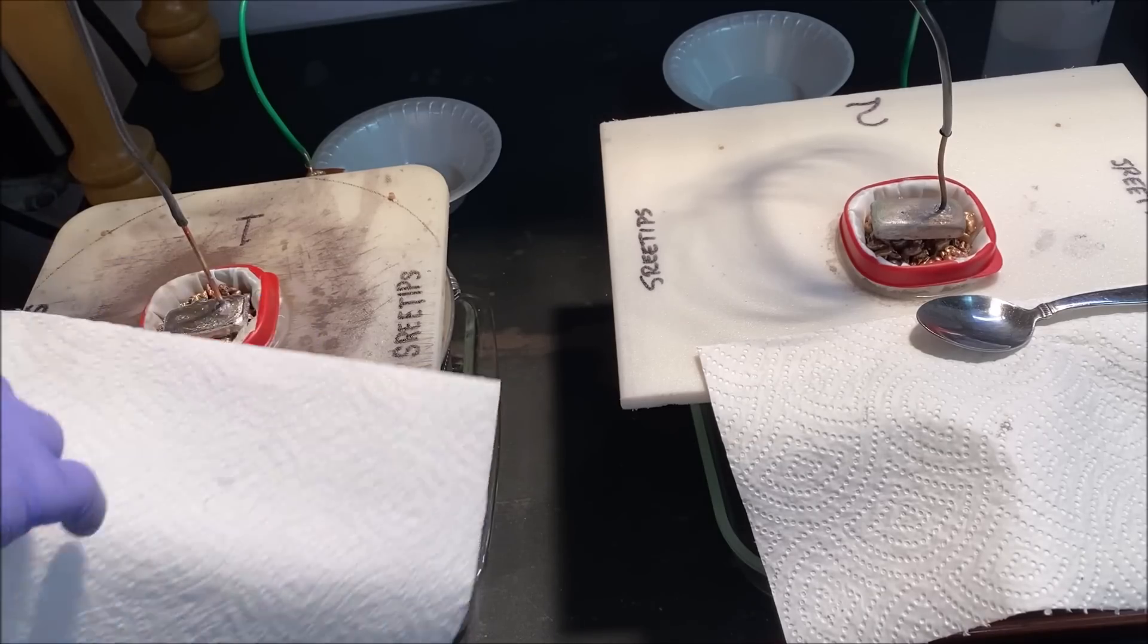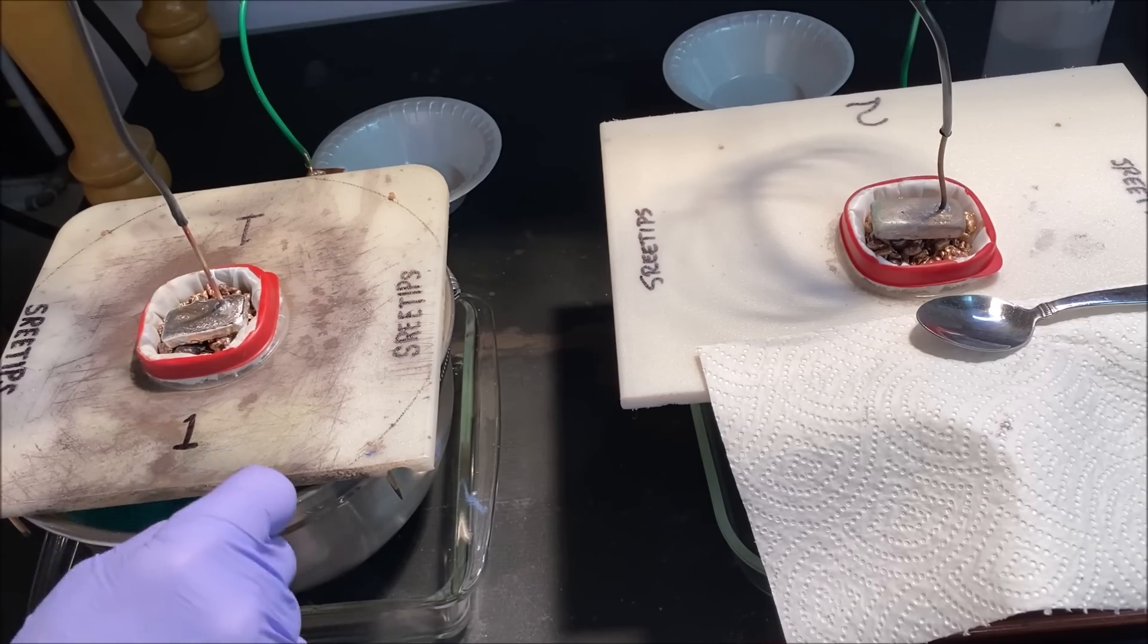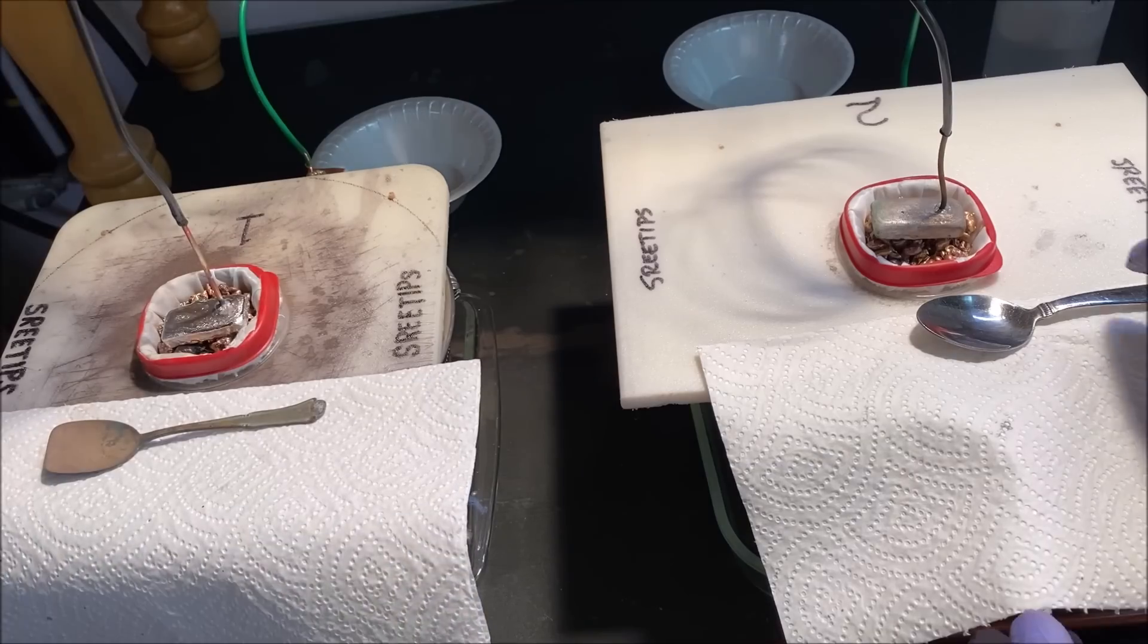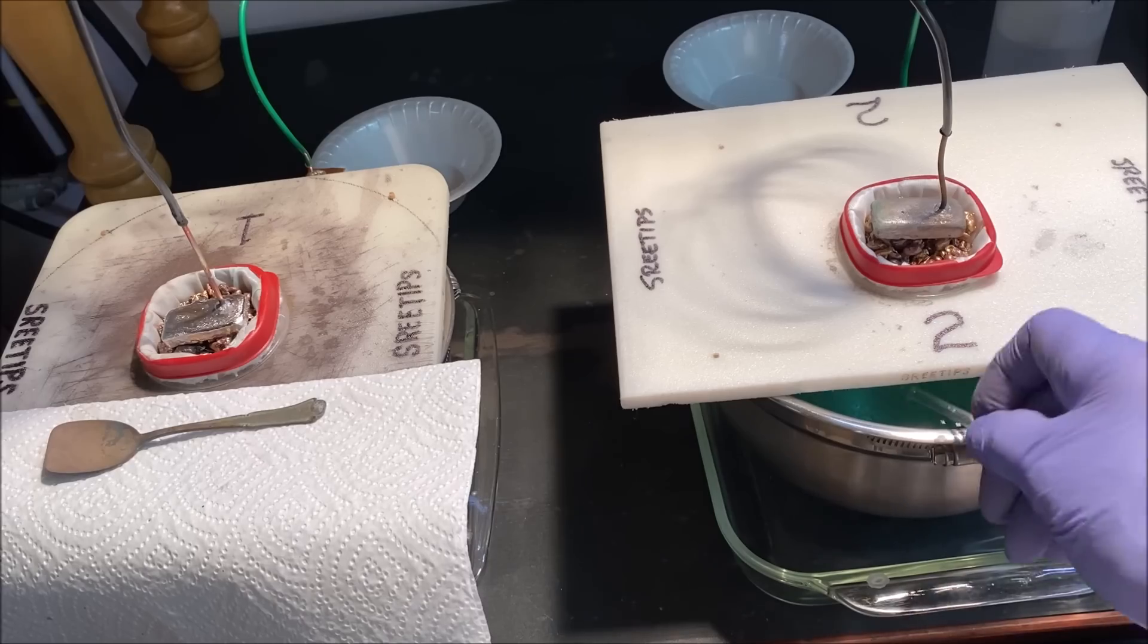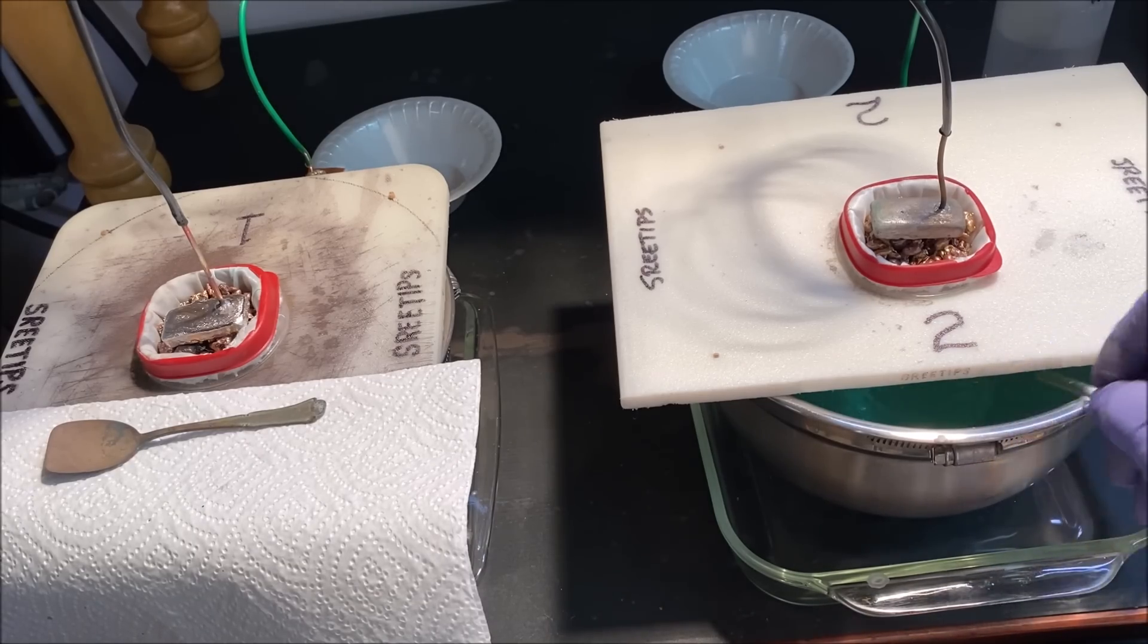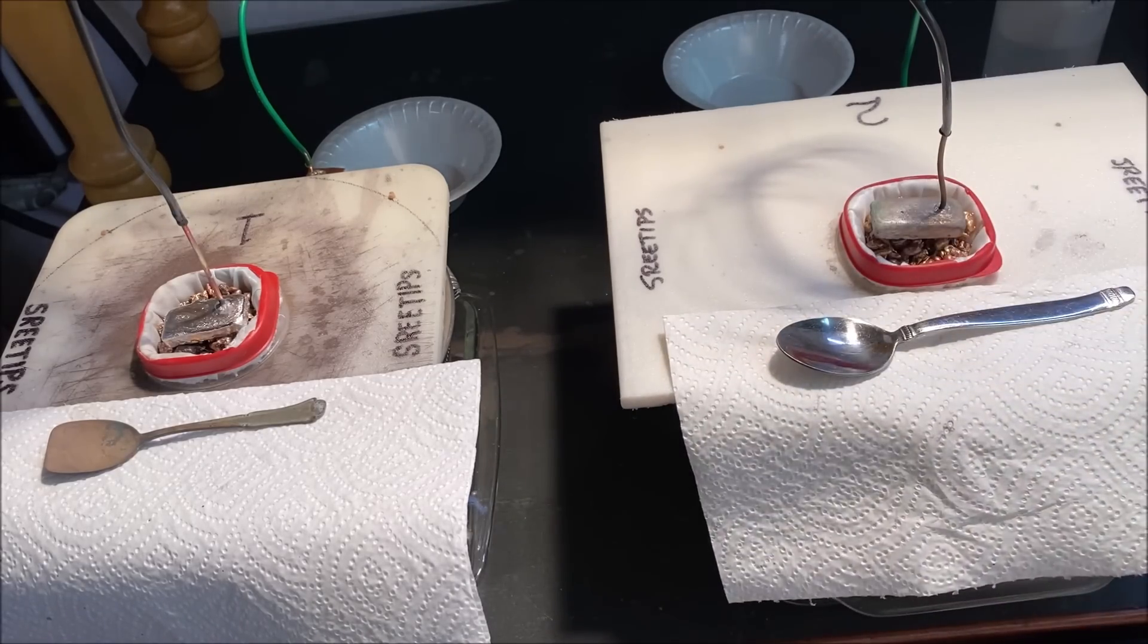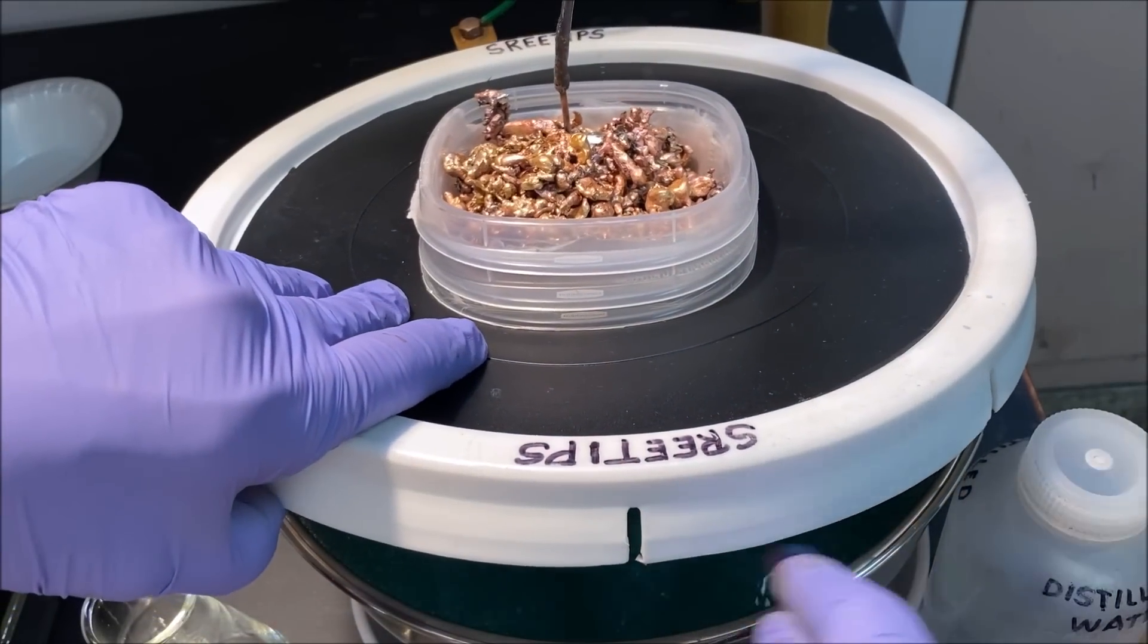Now we're going to go in here and give these a stir. It's always a good idea to stir these things up whenever we get in here to look at them.